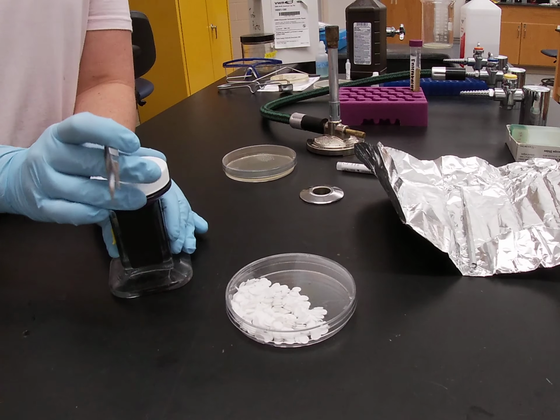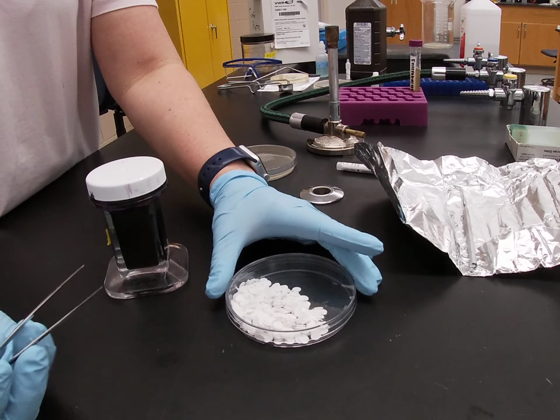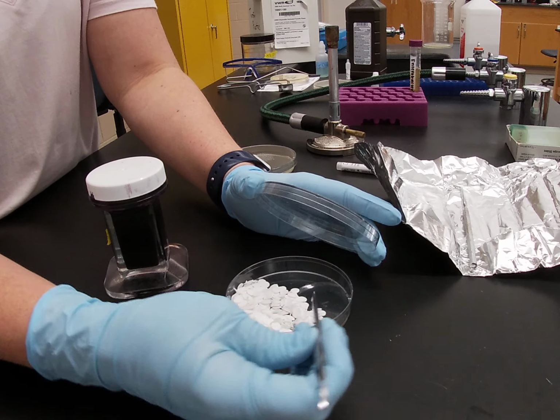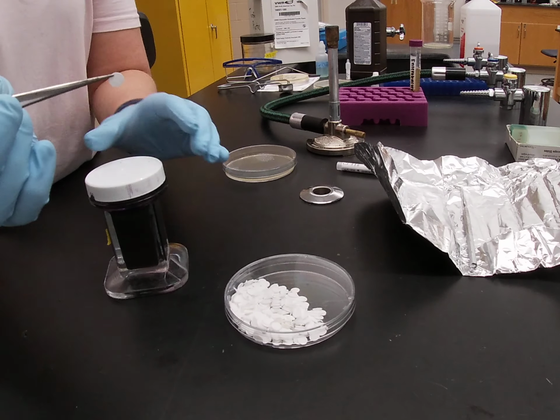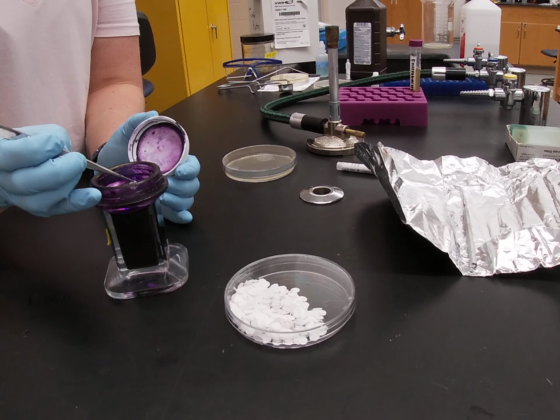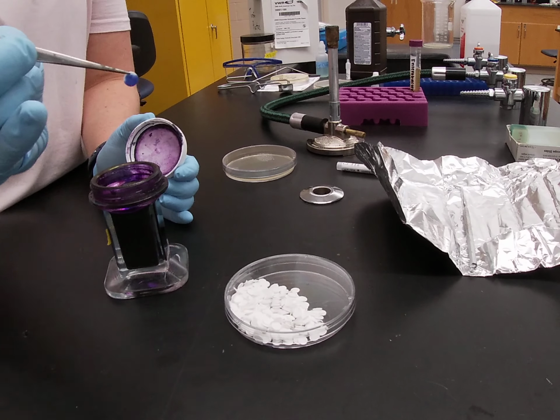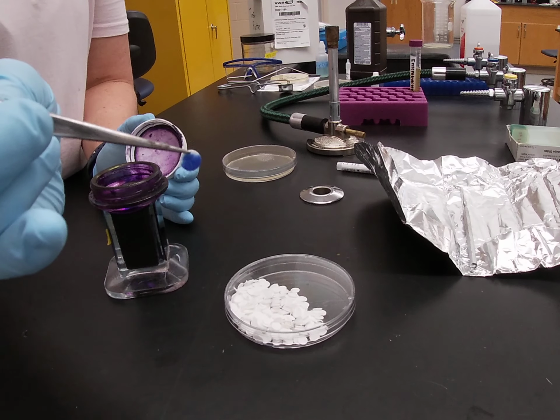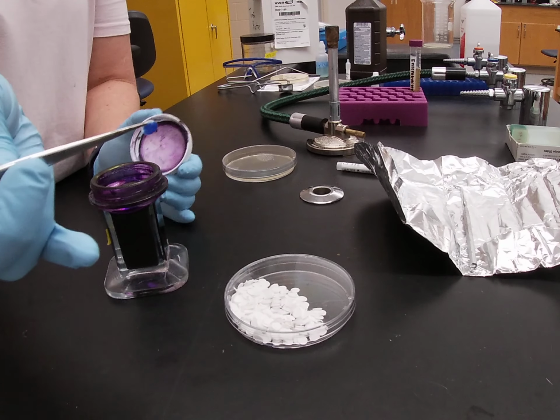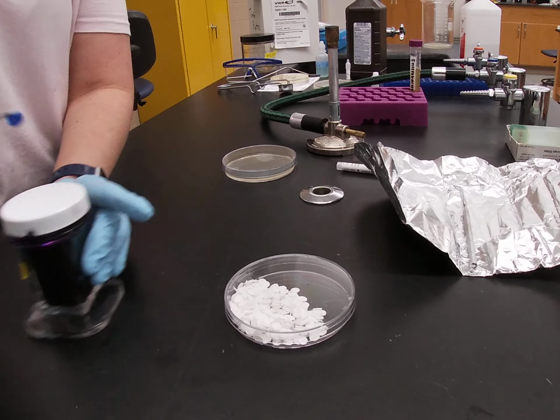To make your own disc, you'll have some kind of antimicrobial liquid, and you're going to very carefully pick up one single disc with your forceps. You're then going to take that disc and just very carefully dip the very edge of it into your liquid, and then the membrane filter itself will actually pull the liquid up and cover the rest of the membrane. If it doesn't cover the whole entire thing, that's okay, there is plenty of it there.